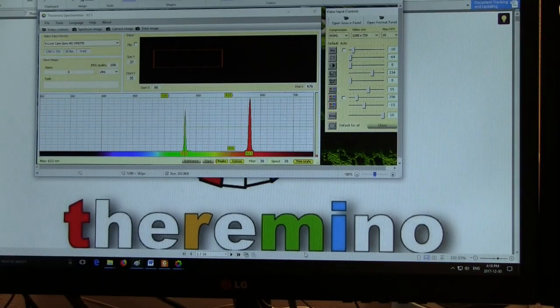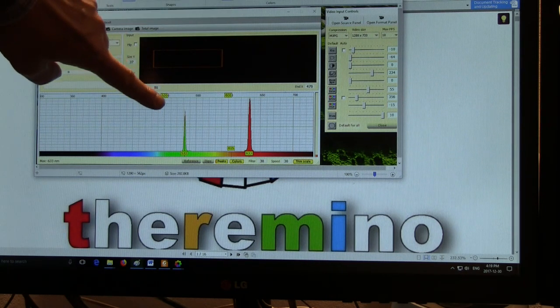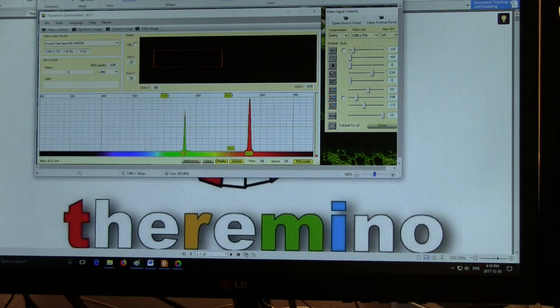Another spectrum that was quite interesting was this one that we developed with the visible spectrometer. And this is looking at two lasers. One is a 632.8 nanometer HeNe laser, and the other one is a 532 nanometer green laser. And I've shone them both on the spectral slit at the same time, and we got this very nice pattern here that is quite useful for calibrating, because you know what the wavelengths of your lasers are, so you can line them up with your system and see them quite clearly. So that was quite good.